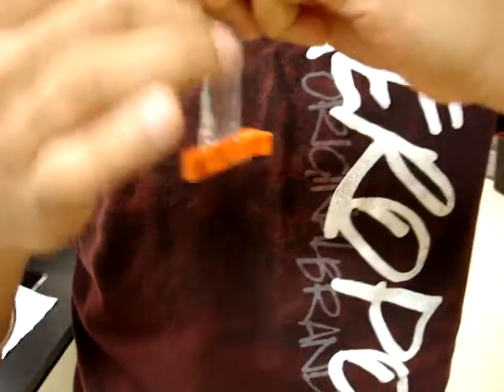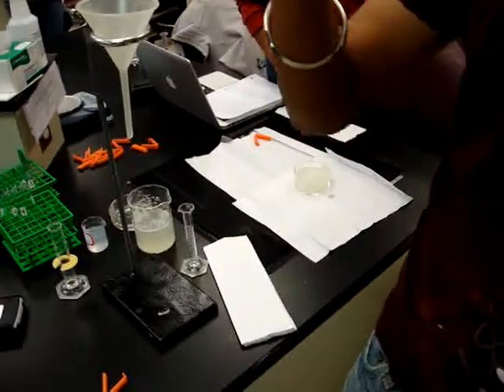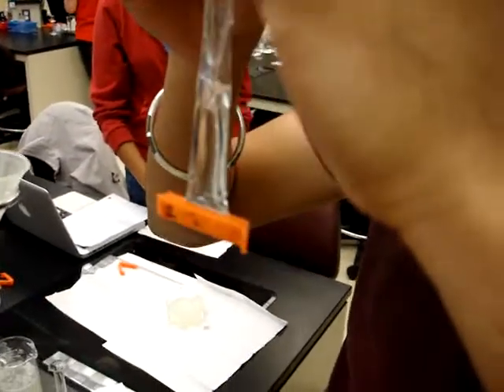Maybe rolling it too tight — there's air in there so I have to air it out. As Dr. Weber said, make sure you don't give it too much time to air out. As soon as you finish, soak it.